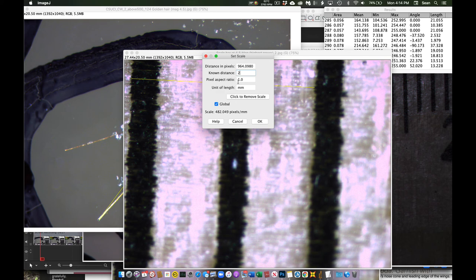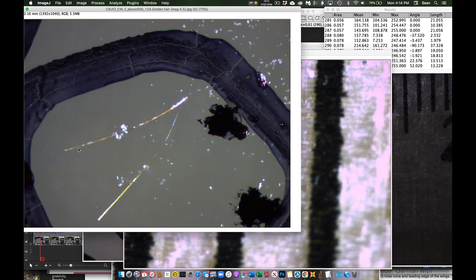The pixel aspect ratio should be 1. Again, that was what was causing my problems. And in this case, it's millimeters, and you want to click global so that it'll apply to your other images, and then say OK, and then it'll be correct. So now, for example, when I do the approximate length of this bad boy, they're similar. They're very similar. So problem solved. Make sure you enter your values in the correct calibration boxes in ImageJ.